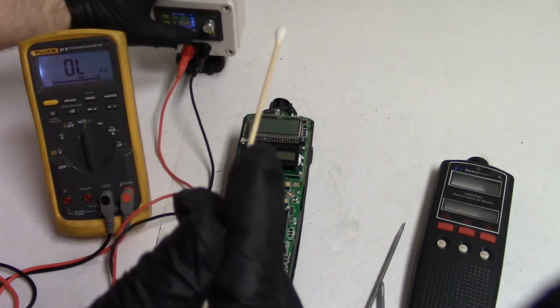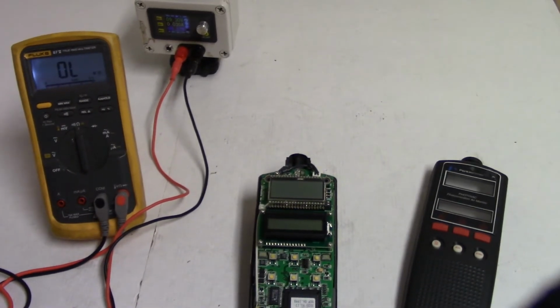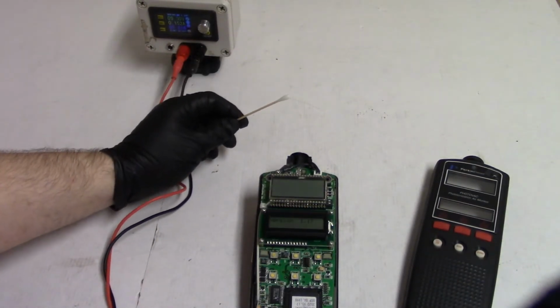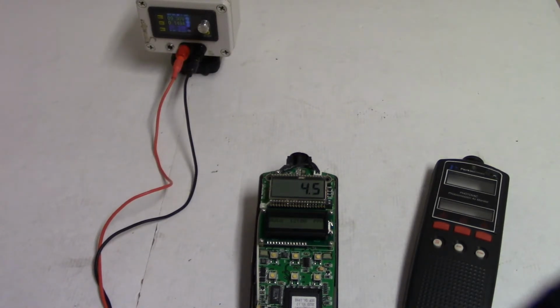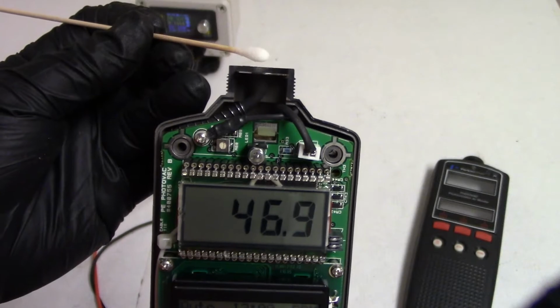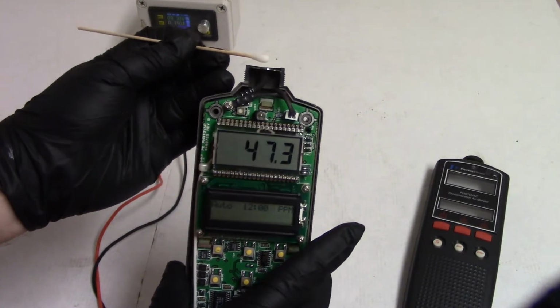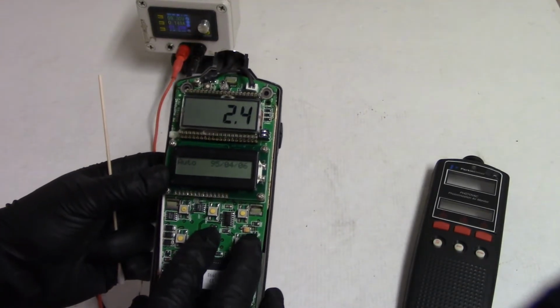Let's turn our battery pack on. Let me move my needle nose out of the way. And let's see what happens. Look at that. So we're getting about 2.5, but if I hold the cotton swab near the tip and it starts inhaling basically that isopropyl, that's tripping the sensor. And if we take it away, we can see it goes away.